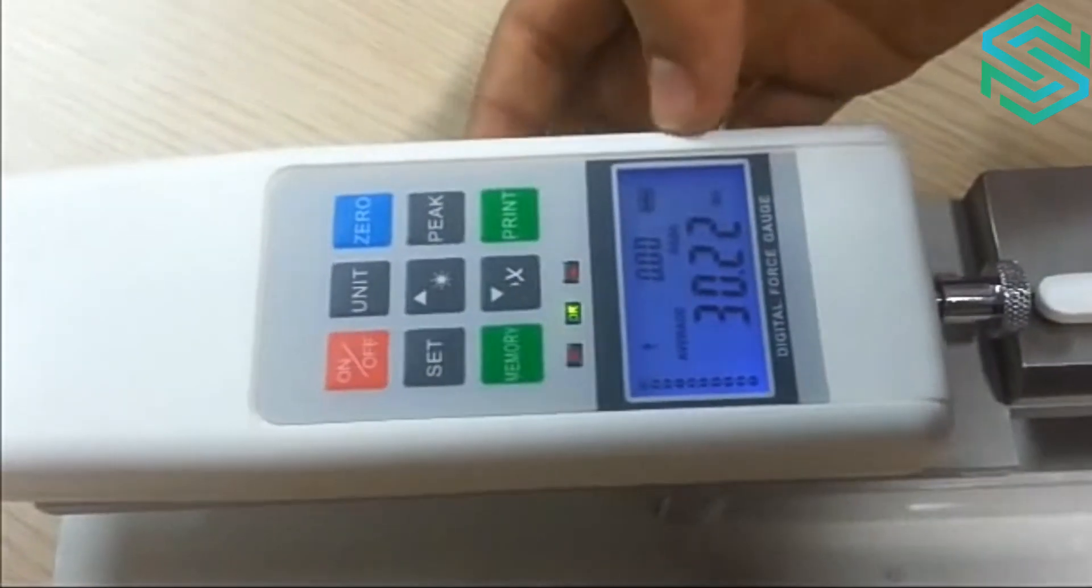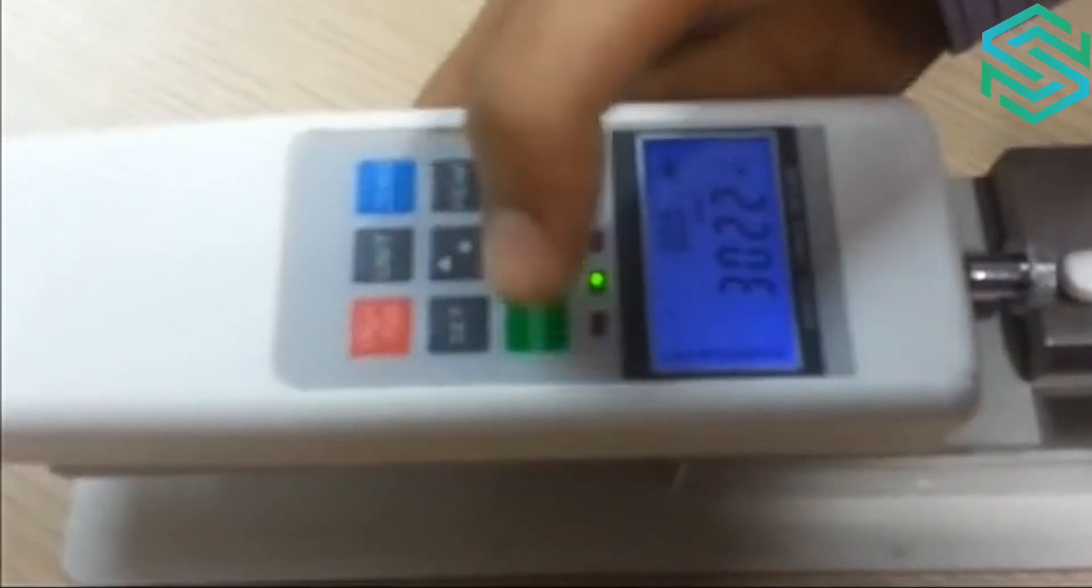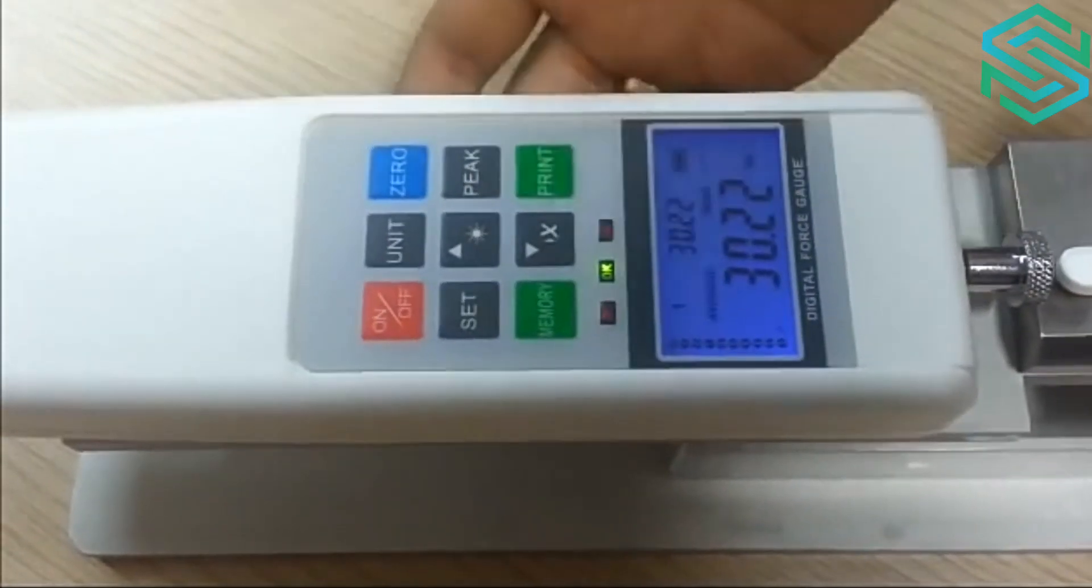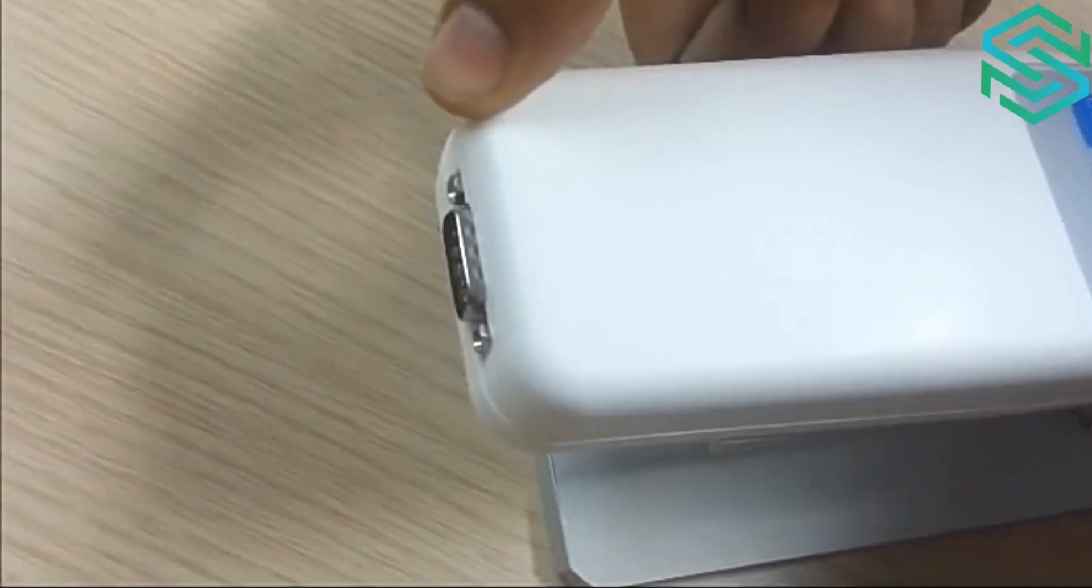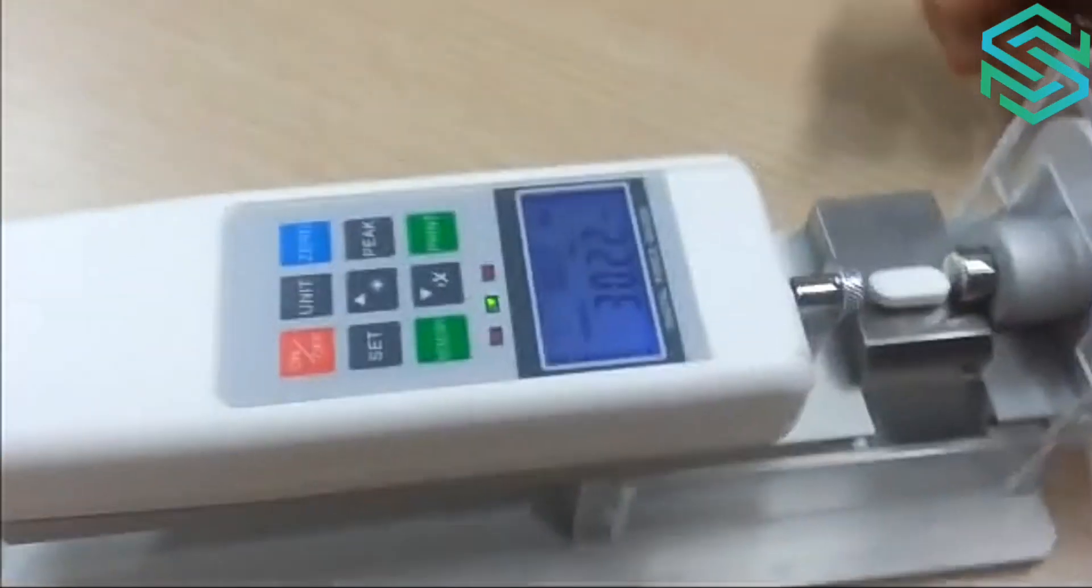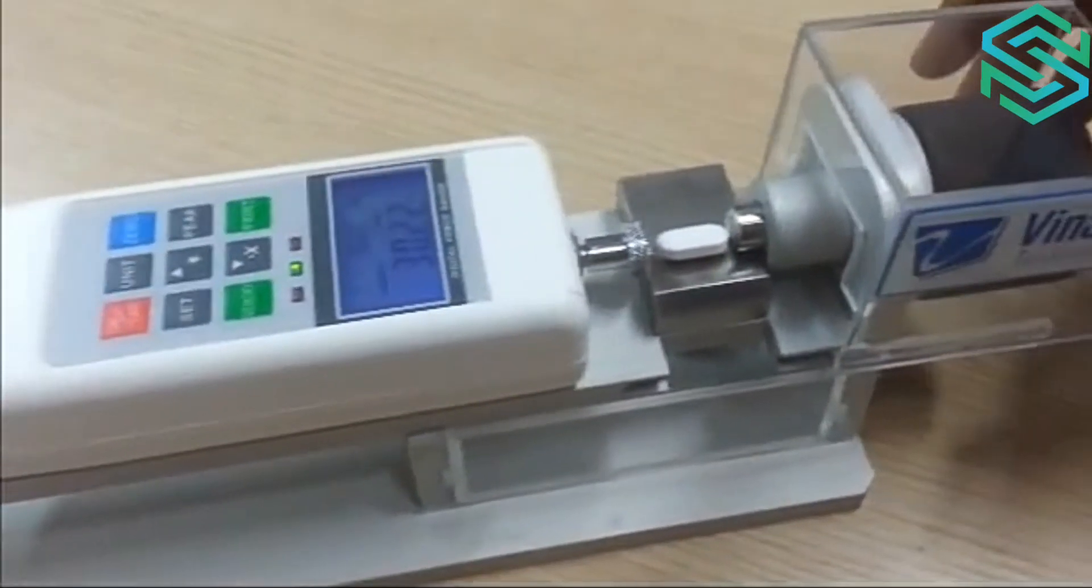You may also save the data with the press of memory button. You may also take a quick printout of the data or you can connect a computer to the RS232 interface provided with the instrument and take the data on your PC with ease.